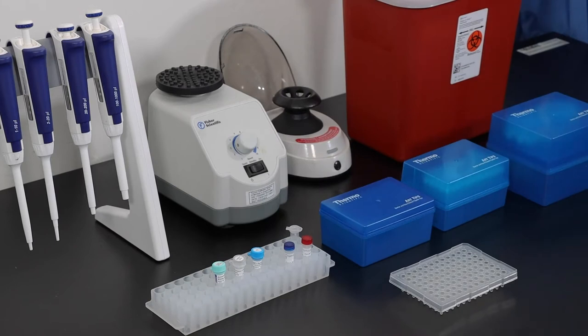Only remove the AMV reverse transcriptase when all other reagents have thawed and you are ready to start.